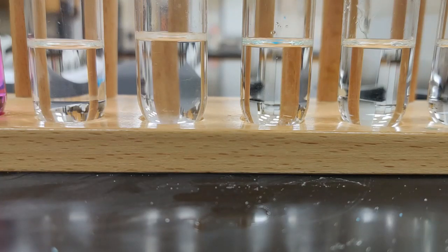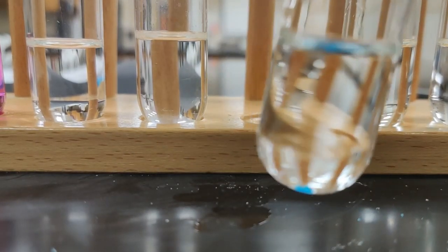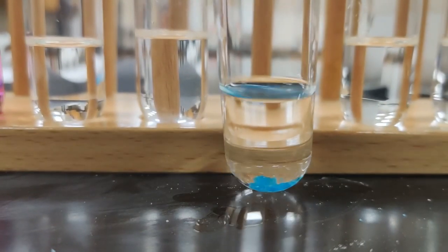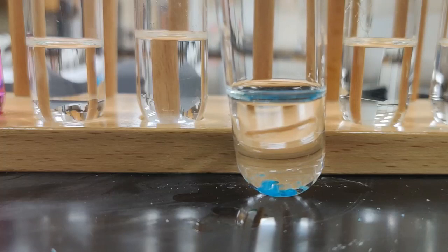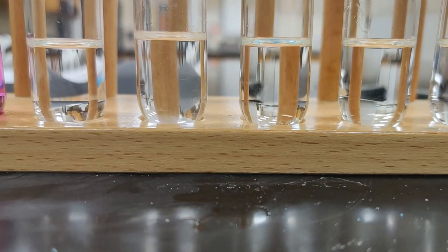I don't feel like I'm going to have a lot of luck here, but again, we don't want to make decisions until we really agitate. But I can see that blue is sitting down there at the bottom. Even though I'm agitating it several times, we can still see the blue down there. Try really one more good time. Nope. Doesn't look like copper sulfate dissolves in hexane. It appears to be insoluble.